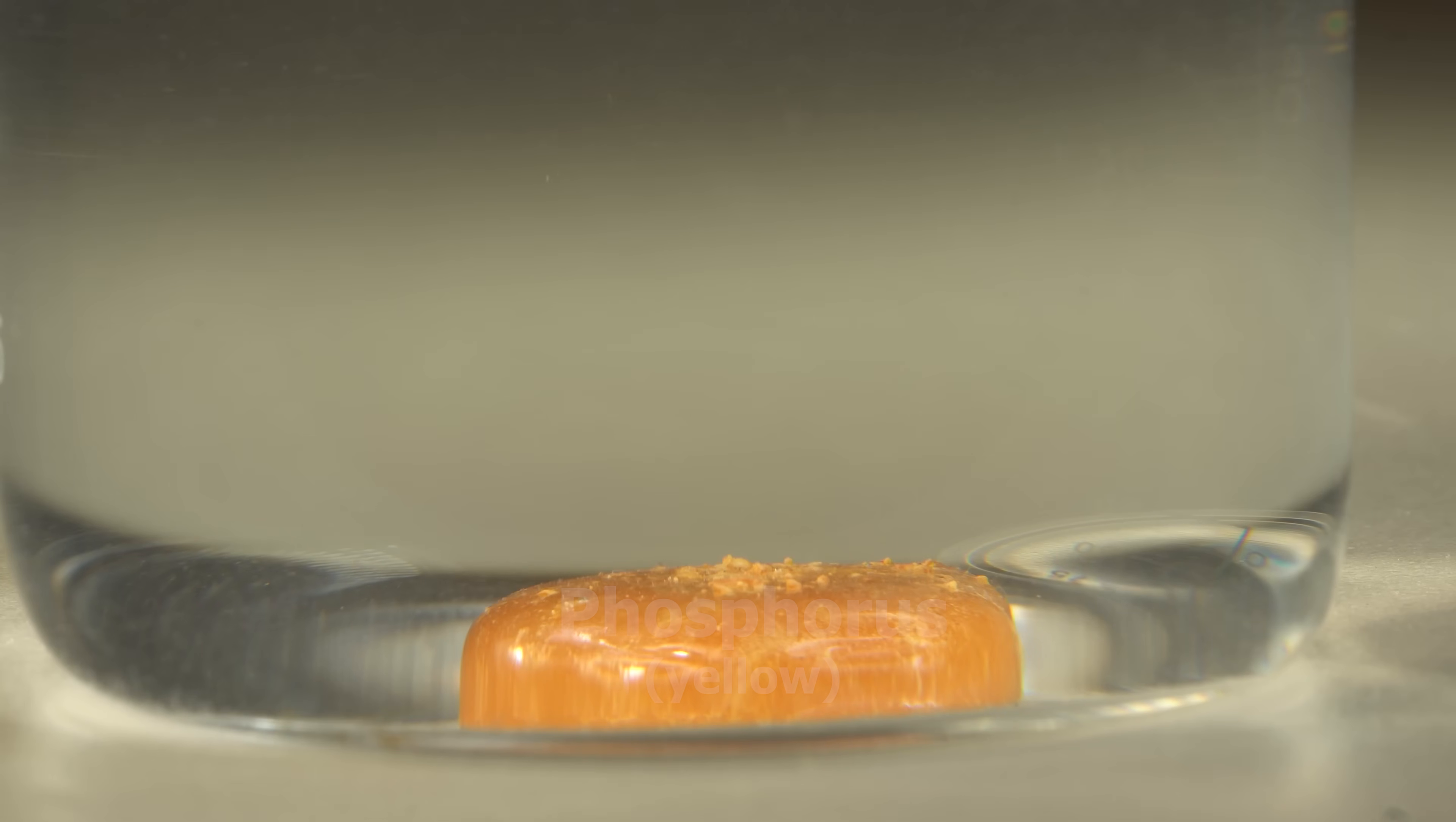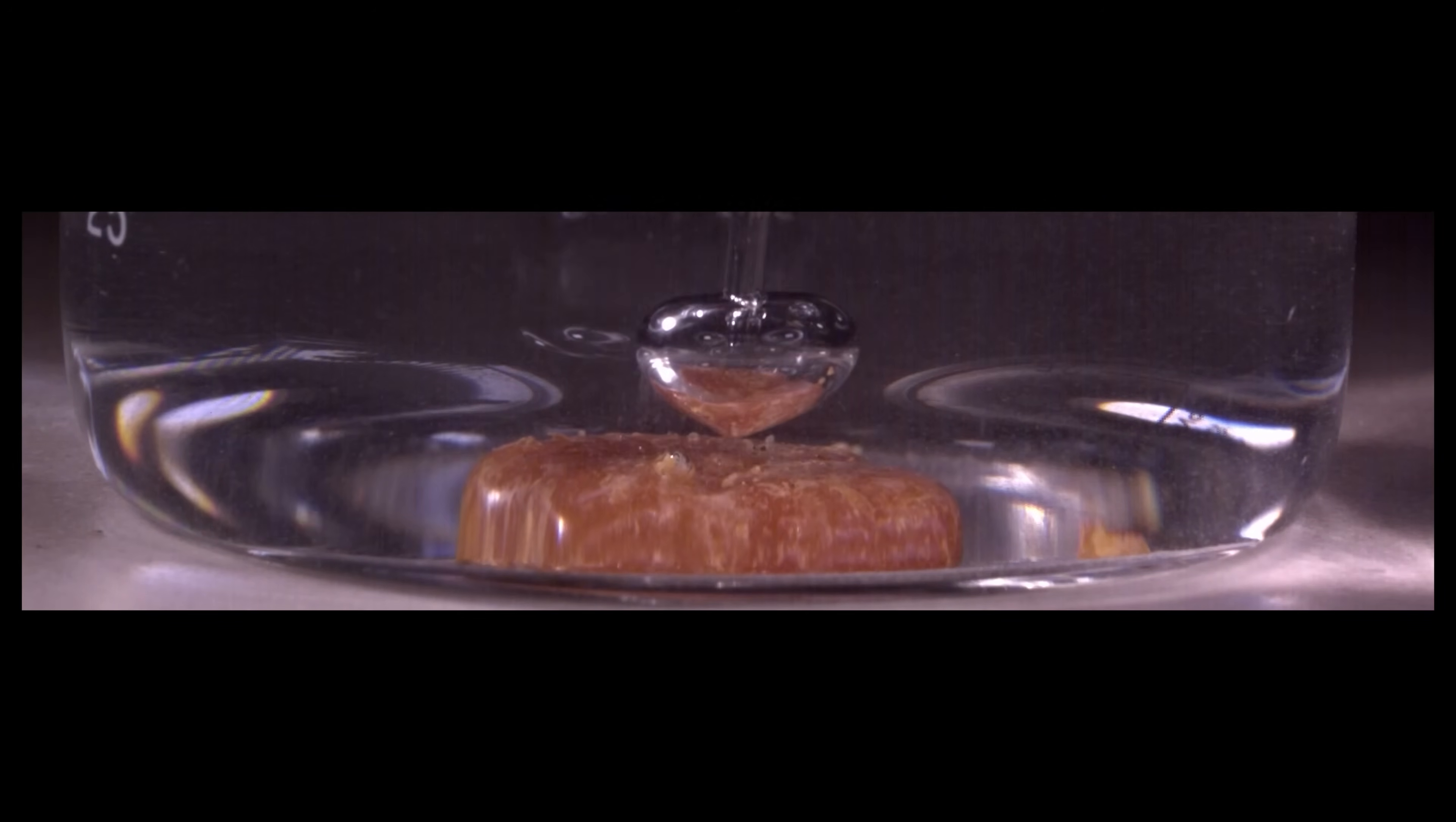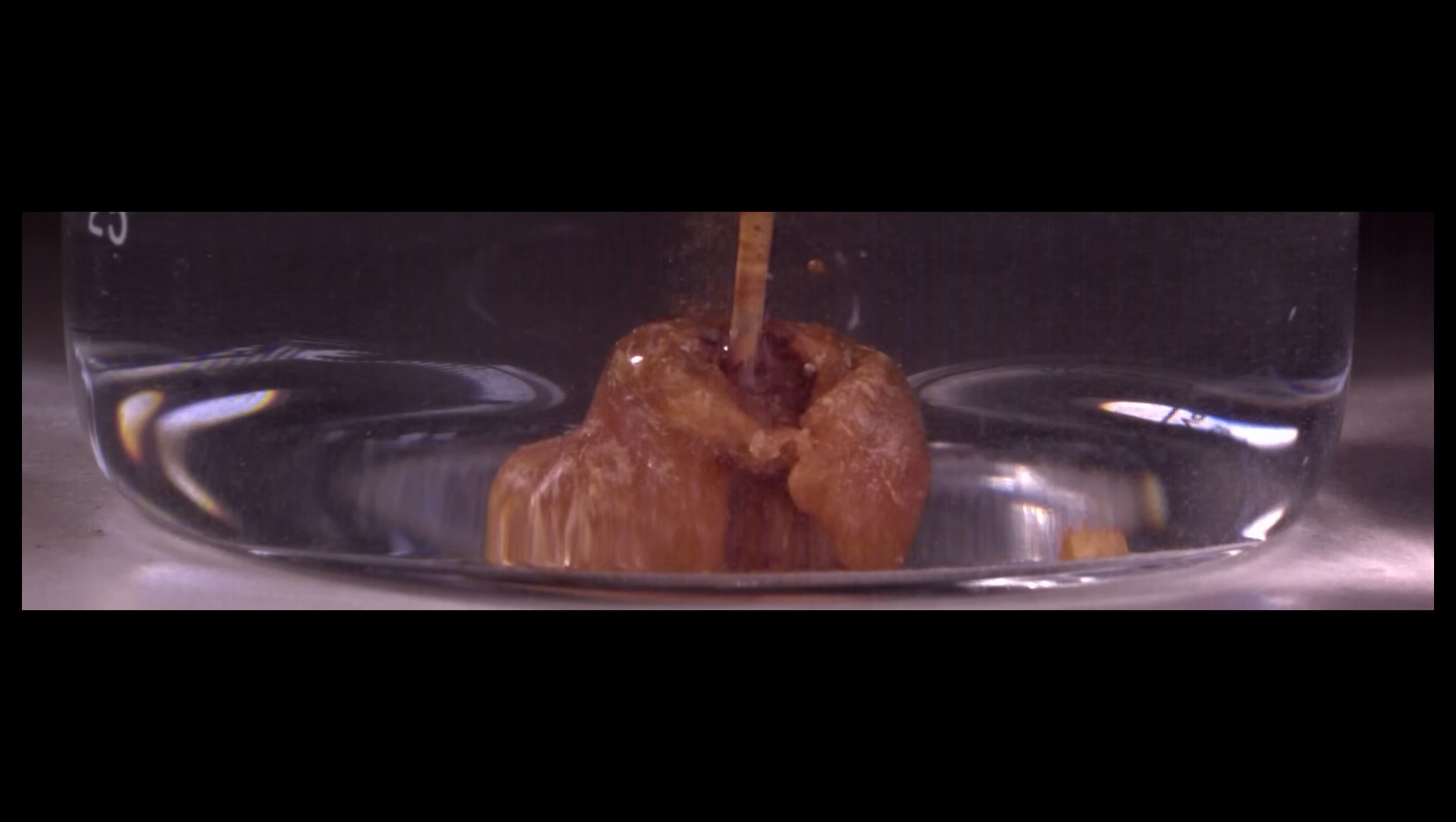Any so-called underwater combustion always occurs inside of a gas bubble formed around a fire source. Phosphorus reacts the same way whilst burning underwater. Watch the gas bubble that the combustion of phosphorus occurs inside of. Thanks to ultra slow-mo you can get a good look at the formation of the gas bubble.